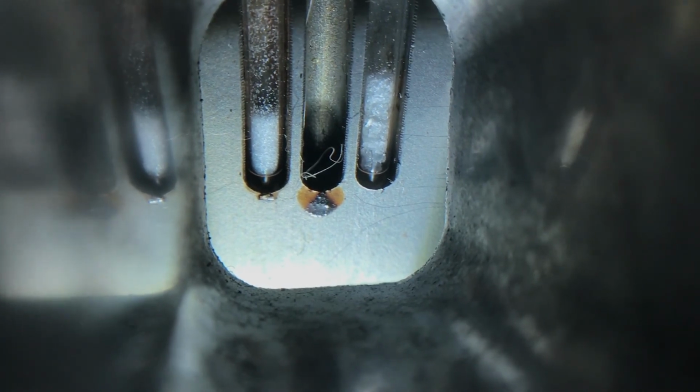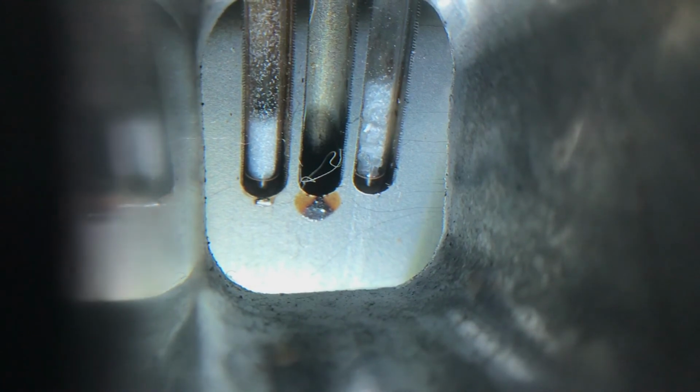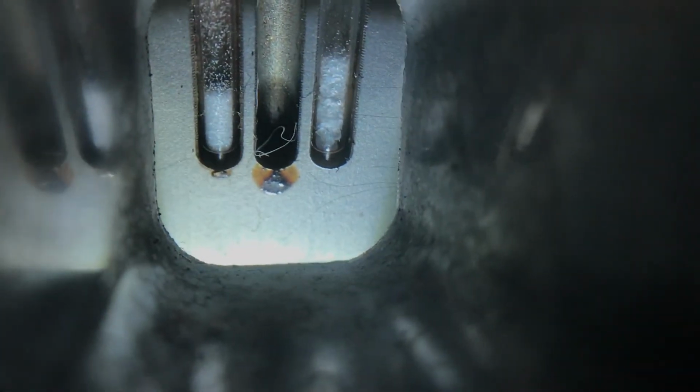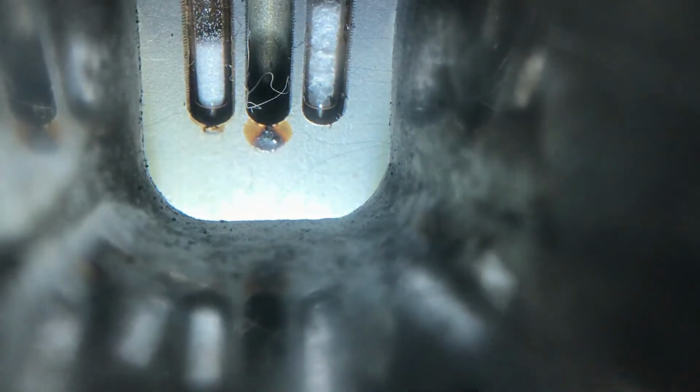A really impure sample will happen over a broader range and often will be depressed relative to the literature melting point. But we didn't do any kind of recrystallization or purification of our sample, so you might see it not be as close to the 98% pure sample we have, but we will see.